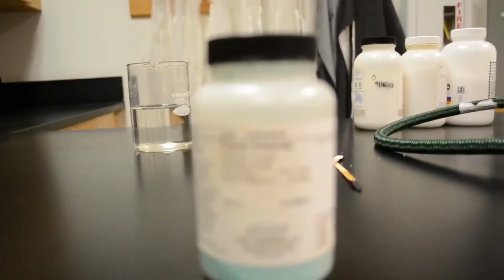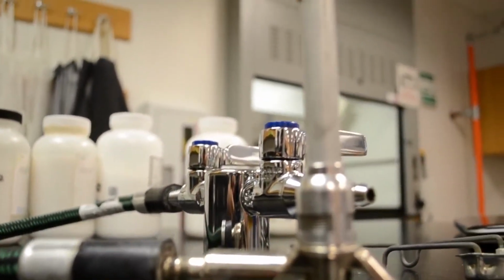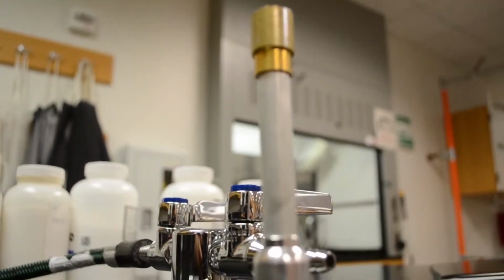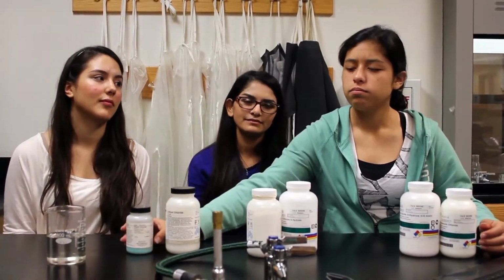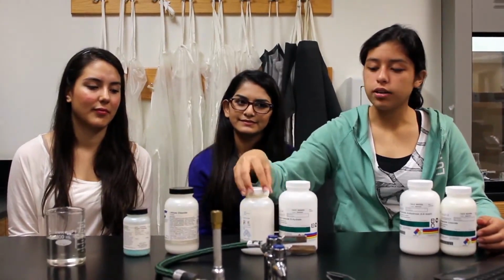And we'll get each of the sticks and without mixing them, dip one stick into a compound such as cupric chloride. And we'll make sure to put that wooden splint into the hottest part of the flame, which is towards the bottom. And we'll observe the color it gives off. For example, cupric chloride, it'll give off a bluish greenish color. And we'll go on with each of them, such as lithium chloride and so on.